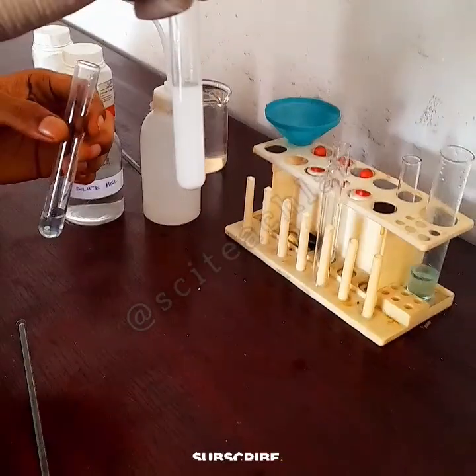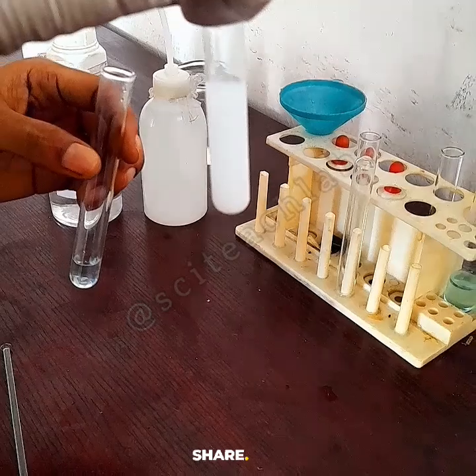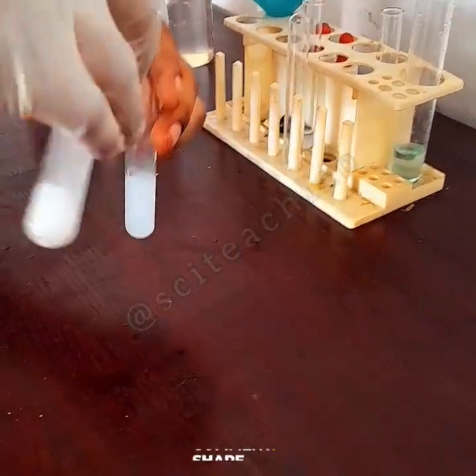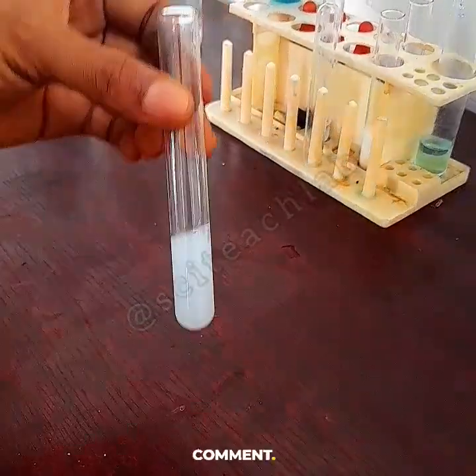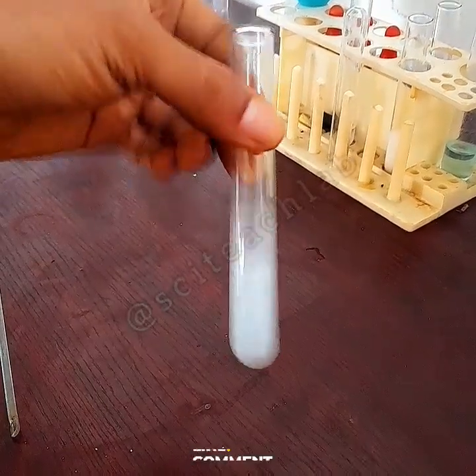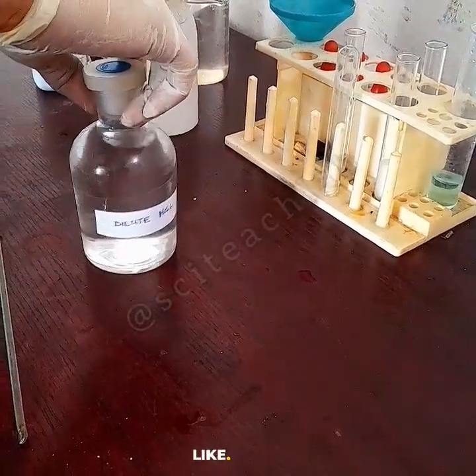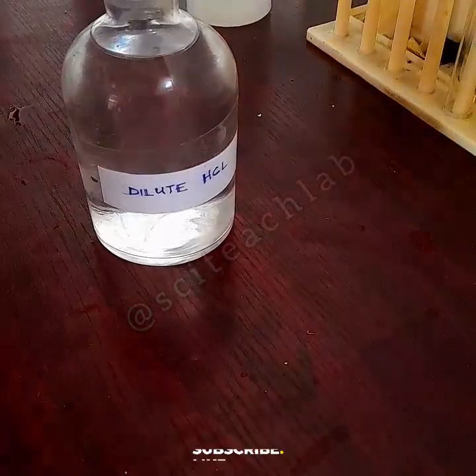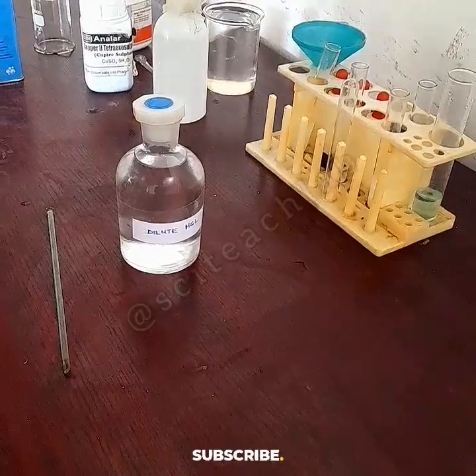This time I'm going to test with barium chloride, which we just made aqueous. I put a little amount of barium chloride, and we see a white precipitate formed. This one is not gelatinous, it's chalky. You see small particles inside that don't adhere to or stick to the walls. They're like when you grind chalk and put it in water. We call that the chalky precipitate.